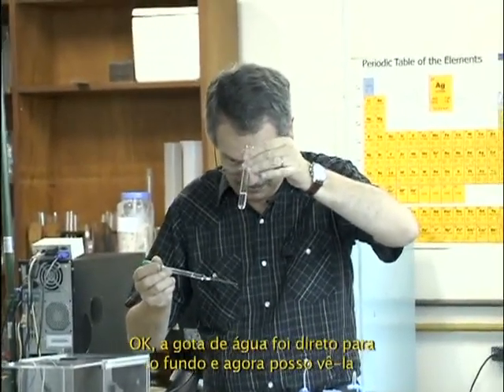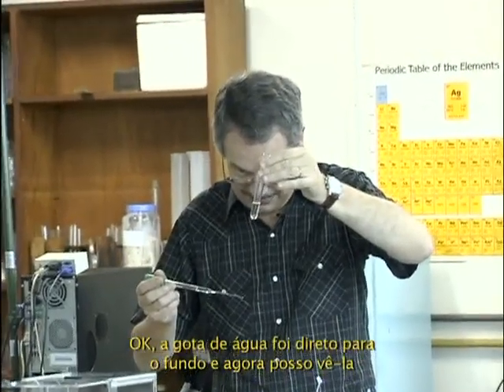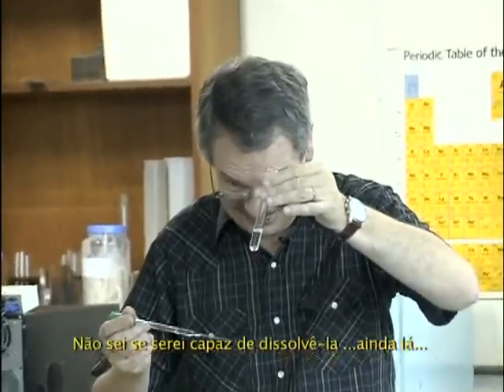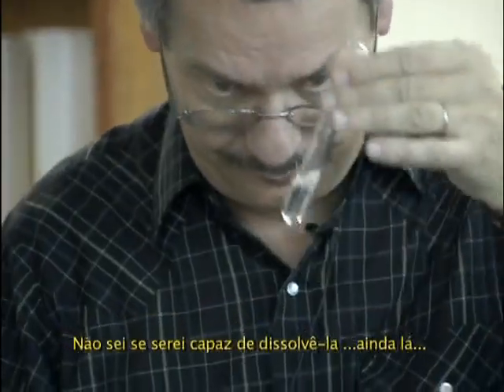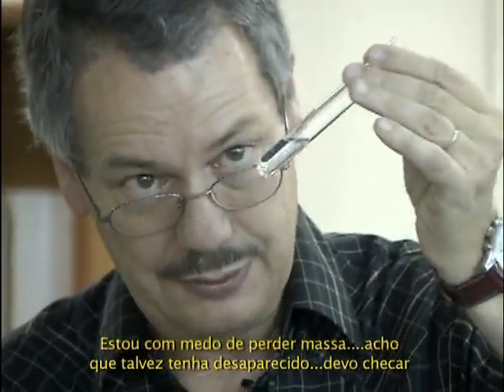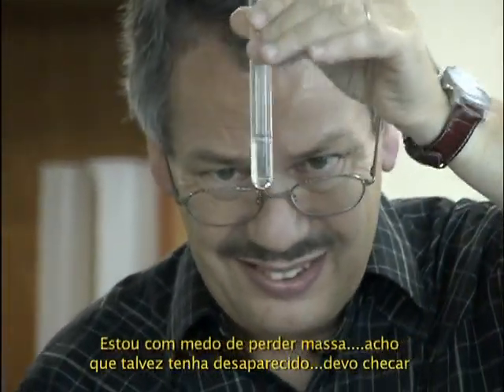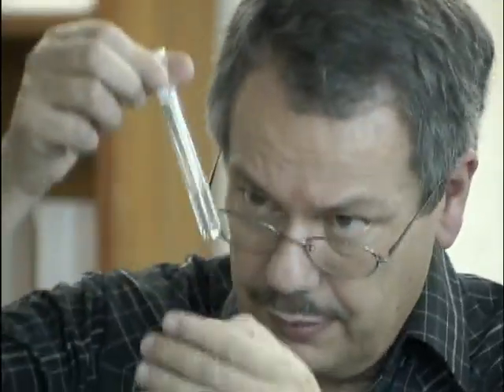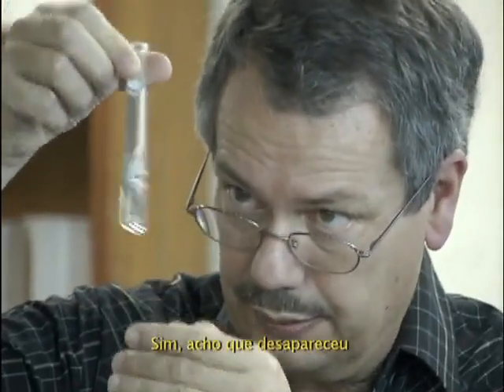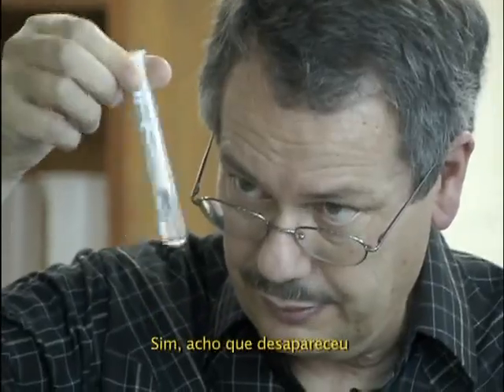Okay, the water drop went right to the bottom, and now I see it, but I don't know if I will be able to dissolve it. It's still there. I am afraid to lose some mass of it. Maybe it disappeared. I should check it. Yeah, I think it disappeared.